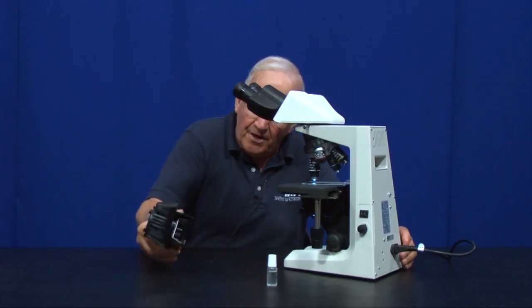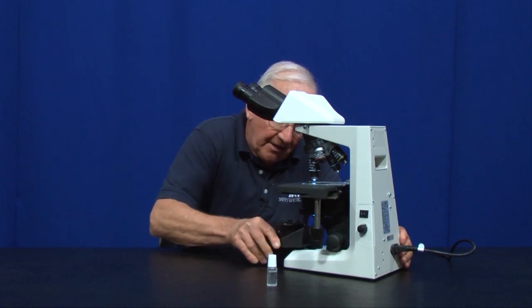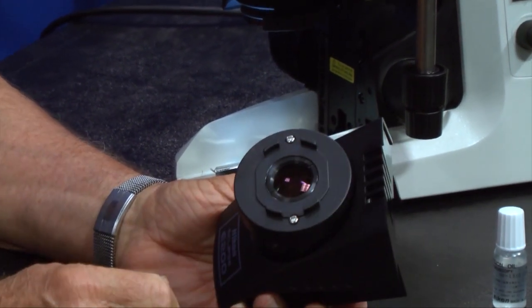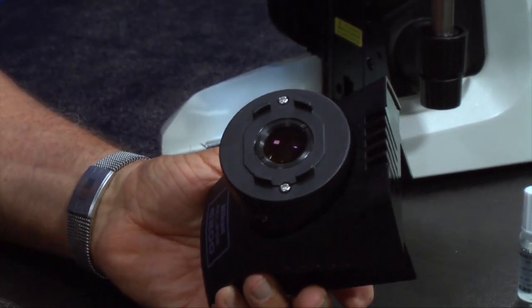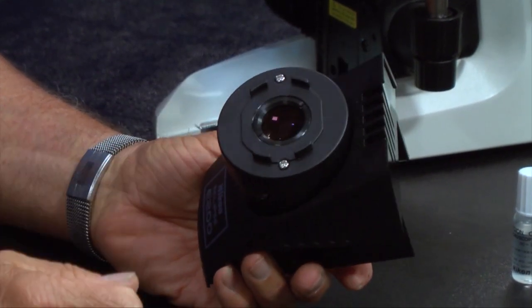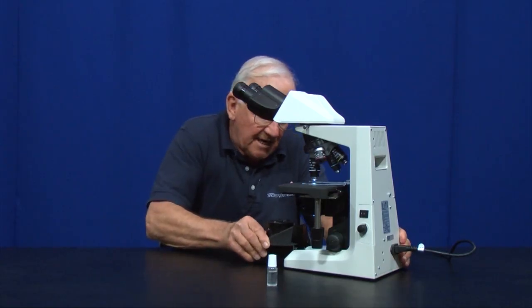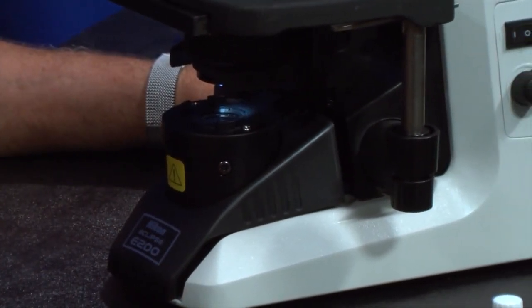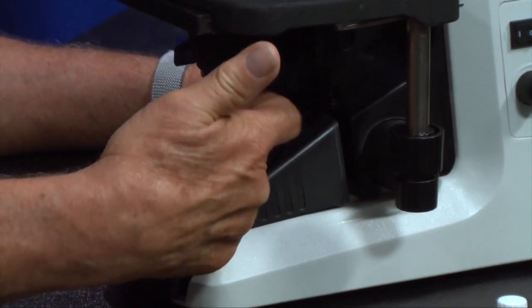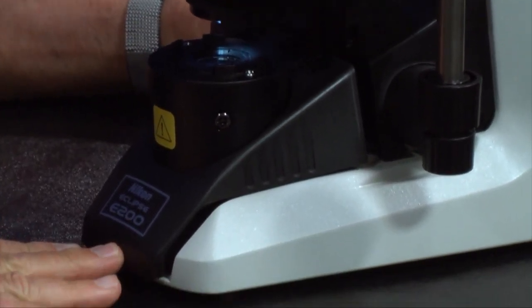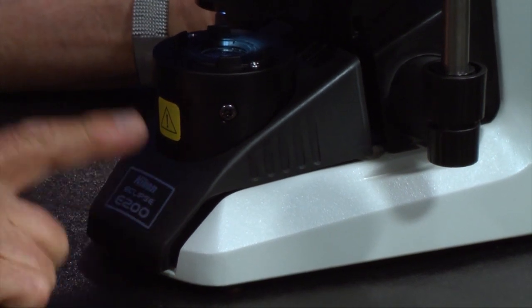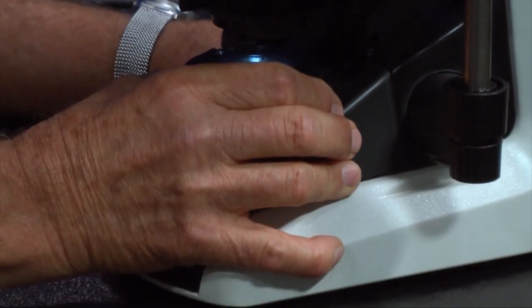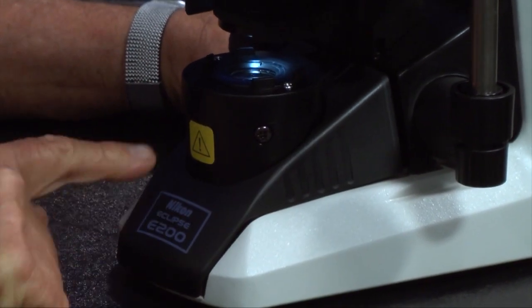We're going to put the field diaphragm unit back onto the microscope like so. You'll notice that this unit has a lens here. It's very important in a microscope that you keep all of the glass surfaces clean from dust, but especially from fingerprints. When I put this on, I could be very cavalier about it and just leave it like so. But the light is not coming straight up through because I didn't push this unit on the microscope completely. If you ever take this off, be sure that you push it back on, because if you don't, the image will be severely distorted.